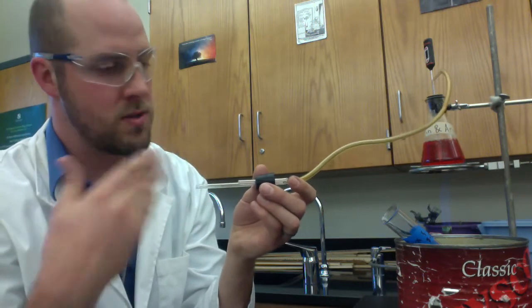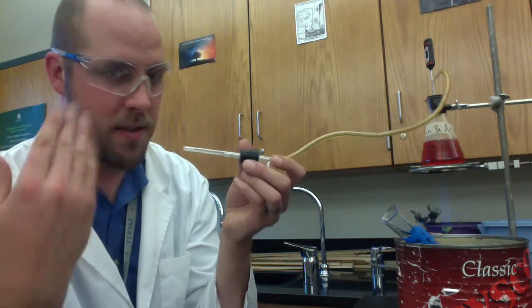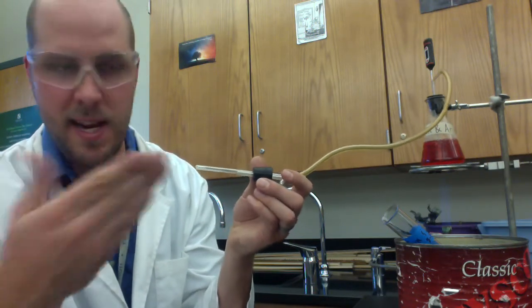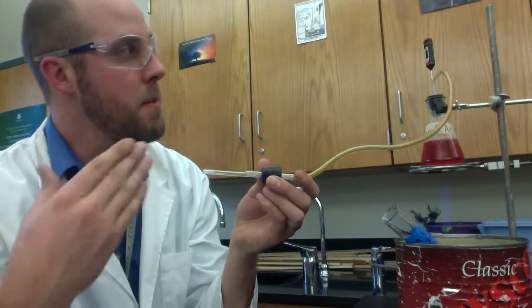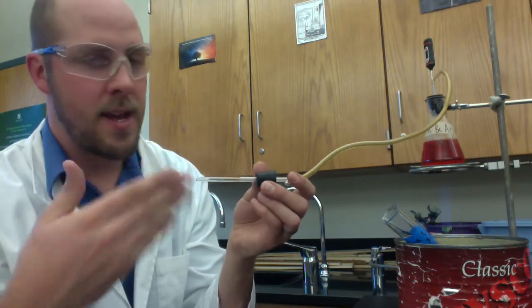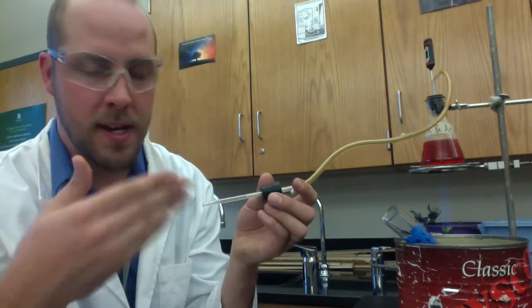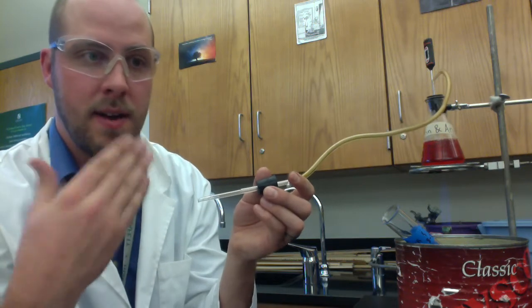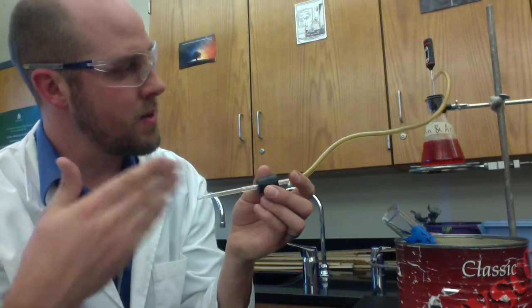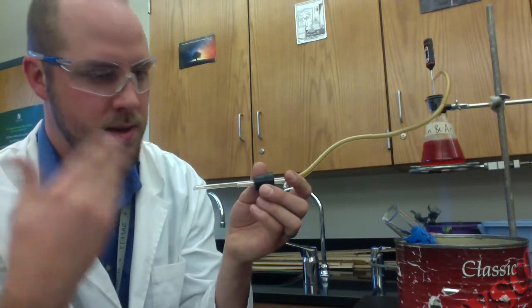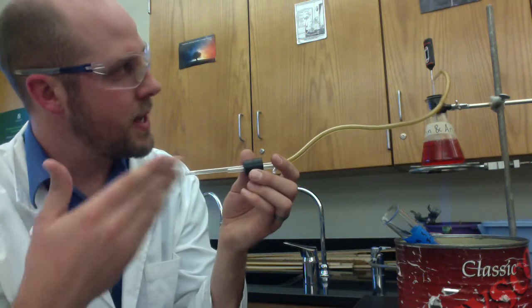So once again you are wafting away. I'm not going to tell you the exact temperature that I smell the fruity ester at because that's going to be kind of giving away one of the purposes of the experiment. But I will tell you it's a relatively low temperature. Esters are pretty finicky little molecules. They don't like to stick around that much in the liquid. They will boil off pretty quickly.